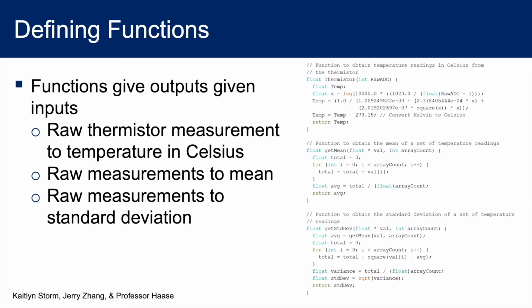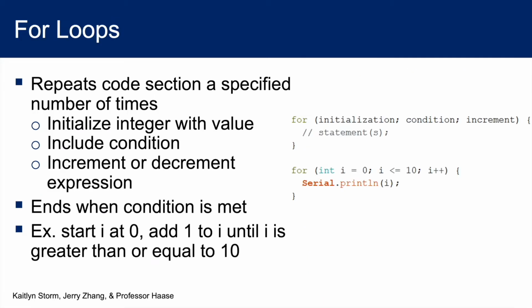Before we move on, let's explore how a for loop works. A for loop is a section of code that will repeat a specified number of times. We create these loops in the following format: creating an integer and assigning a value to start with, and specifying a condition to check, such as if the integer is less than a certain value. So if this is true, then the loop will continue to run. Finally, we have the increment or decrement expression, which increases or decreases the starting variable across trials. Once the specified condition is met, the for loop ends. In this example, we start the integer i at 0, and we add 1 to it every time the code loops. So when i finally reaches or is higher than 10, the loop will end.